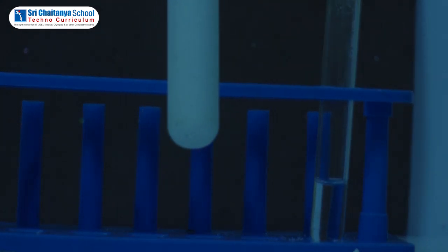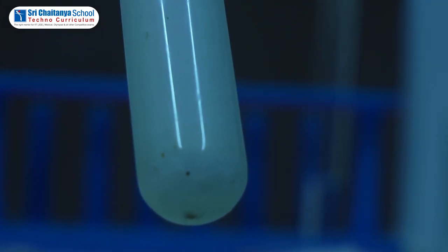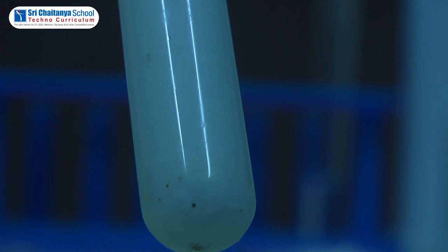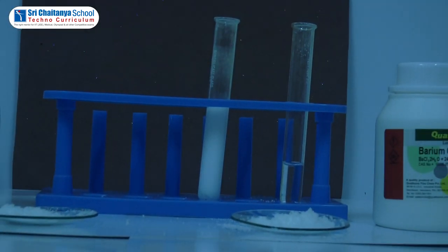Result: a curdy white precipitate of barium sulphate is formed. This is the result of a mutual exchange of ions of both sodium sulphate and barium chloride. Hence, the two solutions undergo a double displacement reaction.